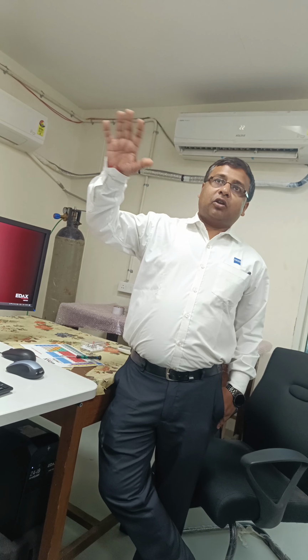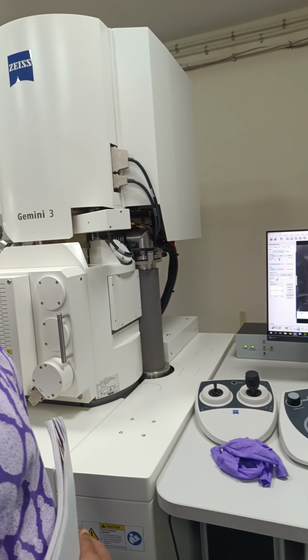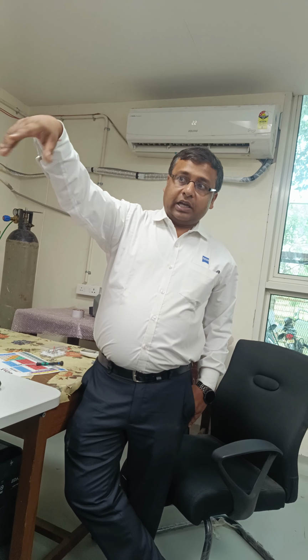You have analyzed FeSEM. You take the sample, and the operator generally does so. Briefly, what Ron has covered in the morning. So this is the electron column. On the top of the column, we have the emitter, a Schottky field emitter. After that, a series of lenses, condenser and objective. We have scanning coils also, because it is a scanning electron microscope, and as Ron explained, there are several detectors.